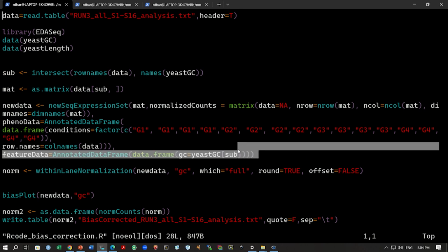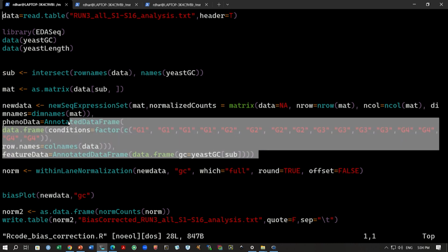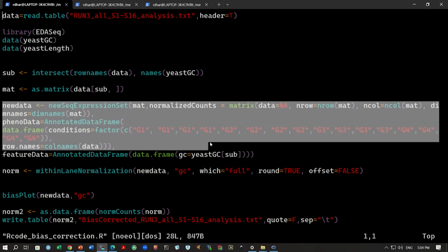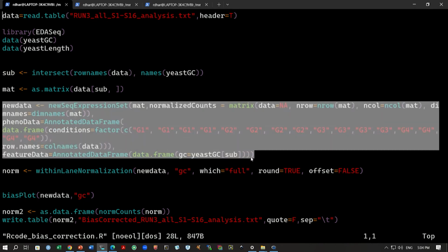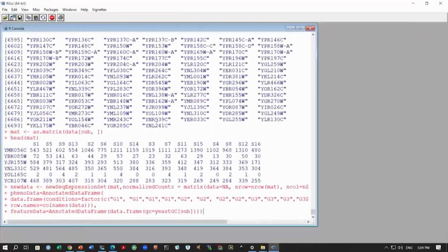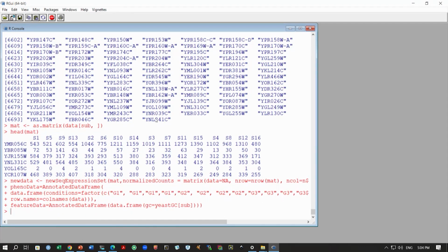So, this belongs to the yeastGC sub. Again, it might seem complicated, but we are following the functions that are given in the manual, and I will show you in a moment. Okay. So, then we can run this. It is a big command, right. You can see it goes to multiple lines, but in R it is okay, right. It simply shows this plus, and then we can run the full command.